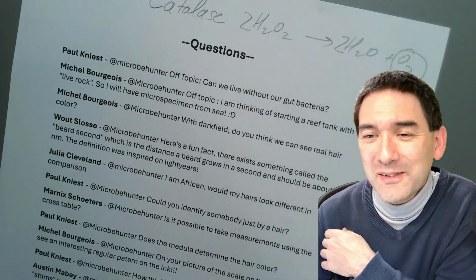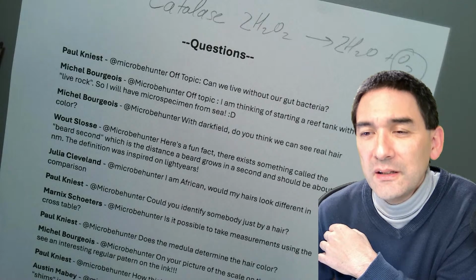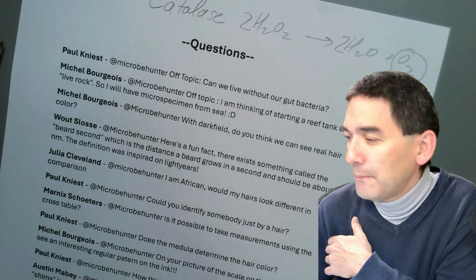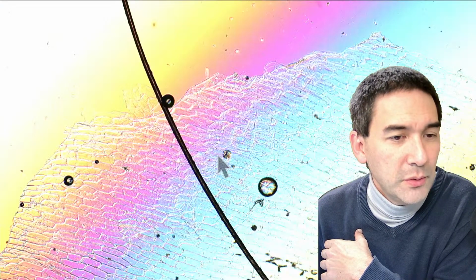Yeah. So, what's the purpose of adding water? I talked about this. Yeah. Do these onion cells have vacuoles? Yes, they do. Pretty large ones. And can they be made visible? You know what? Is the onion cell still in here? If you're asking already, then why not talk about those?